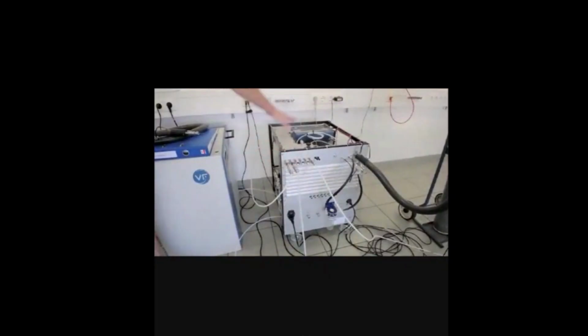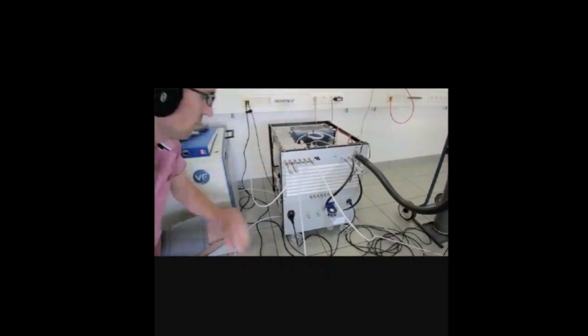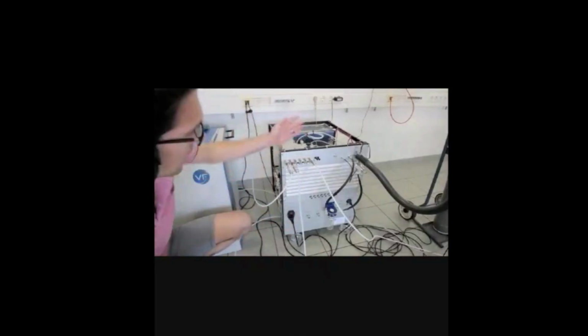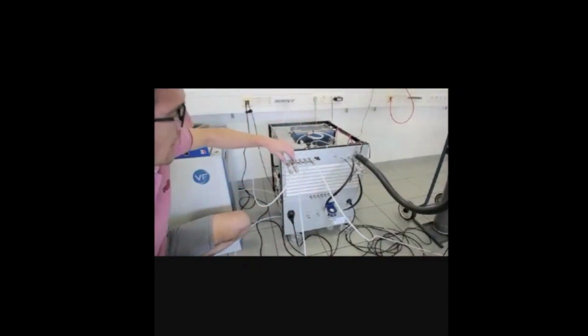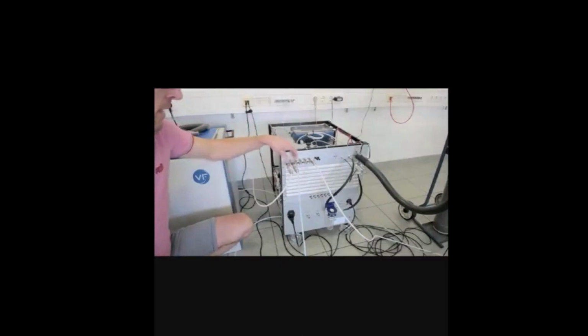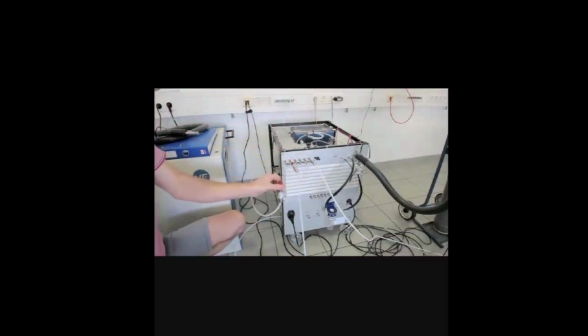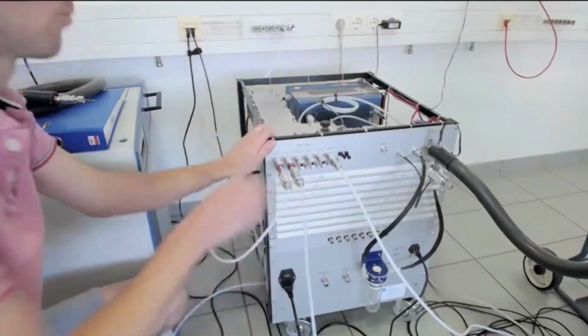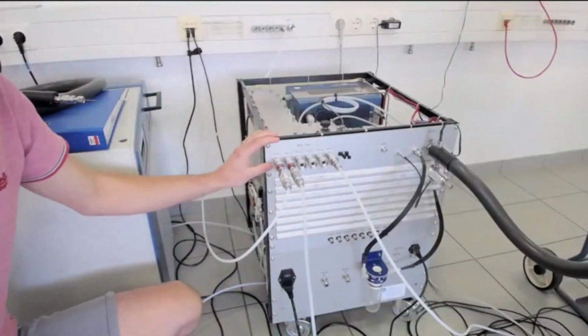Okay, so we have rotated the instrument. This is what we call the backside of the instrument. This is where all of the connections are. Here we have the main power supply and main power switch. On top are all the calibration gas inlets. In order to do the calibration for the SO2 measurement, we will have to provide a zero gas. These are quick connector systems. All of these come with the instrument, so you can attach them to a 1/4-inch Teflon line. The way they lock in is you just push them in, and then it is gas tight.